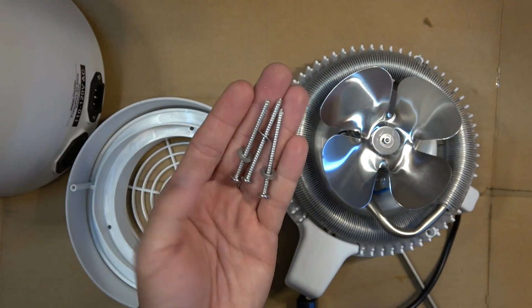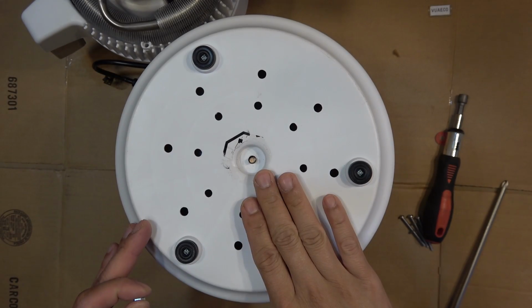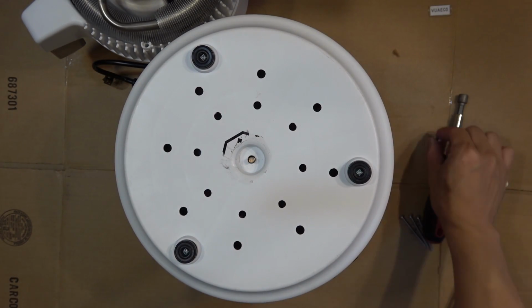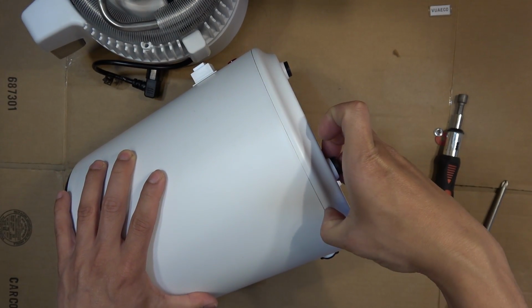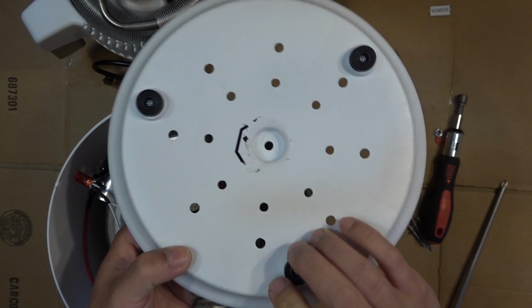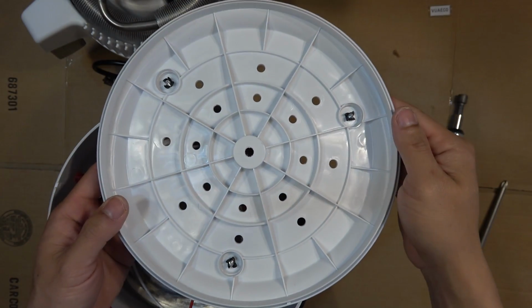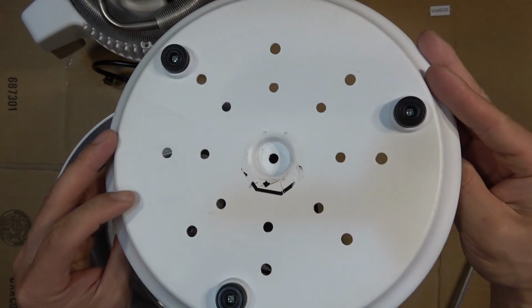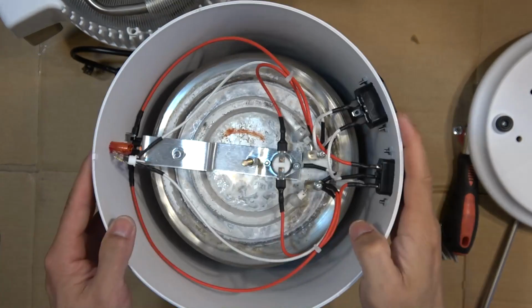Got the top cover out, three screws. Right, so I got the bottom cover out. There's only a single nut right in the center. It holds it together. So you just peel this off. You don't have to remove the three screws because the three rubber feet stand alone. Okay. Right, so here is the bottom of the main unit.